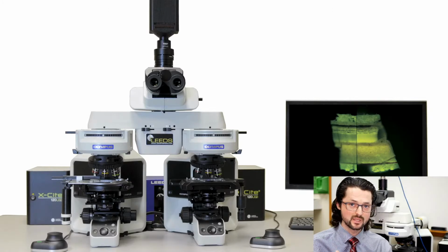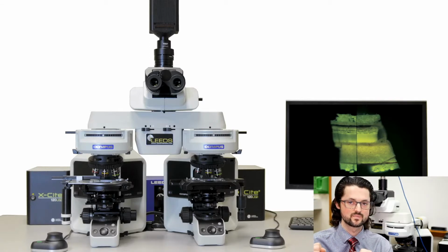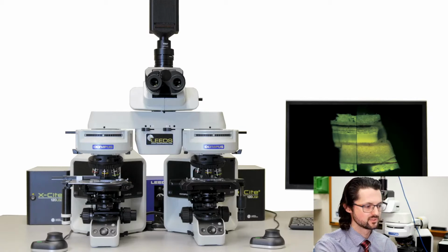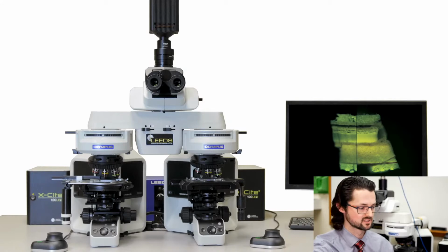But it's also really bright because unlike a mercury arc lamp, which has a lot of waste heat, the LED itself emits really the spectrum that we're interested in. And it's broader than the mercury arc lamp. Another neat thing about these fluorescence LEDs is it also opens up a whole new avenue of being able to do reflected light techniques, not just fluorescence techniques.